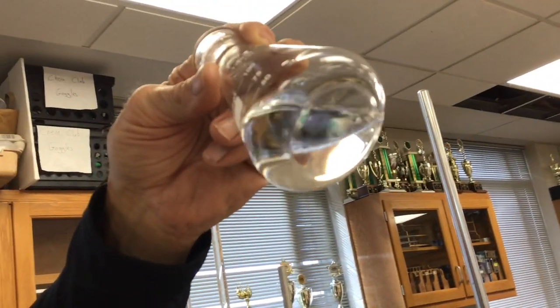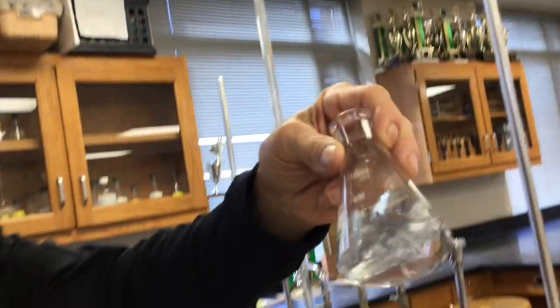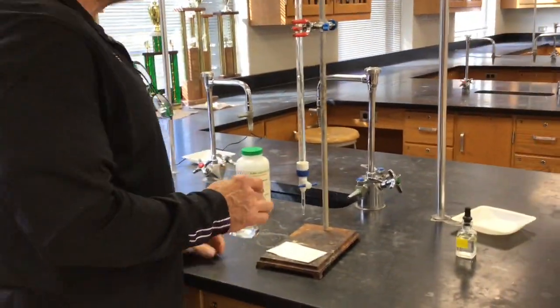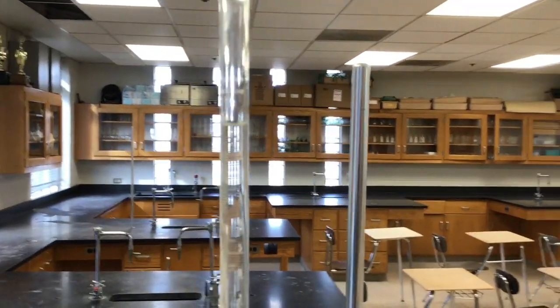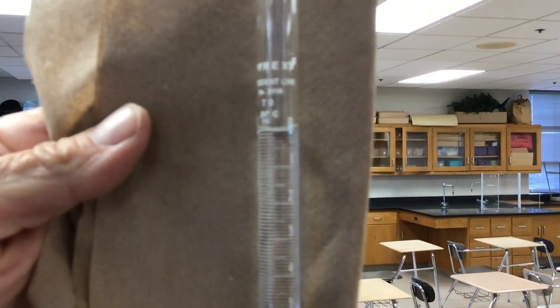You ever heard the old saying, patience is a virtue? All right, patience counts here. We want it to be dissolved. I think it's gone. It looks like it to me when we held it up to the bottom. All right, I think here we go. And did we tell him this, Mr. Moore? Yeah, we refilled the burette. It is once again at 0.00 milliliters.